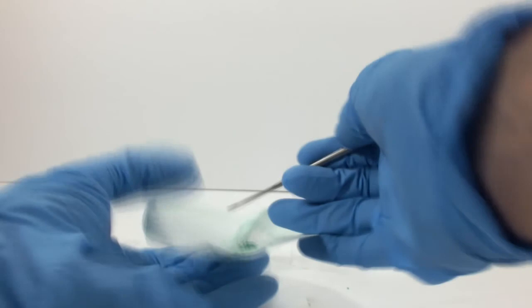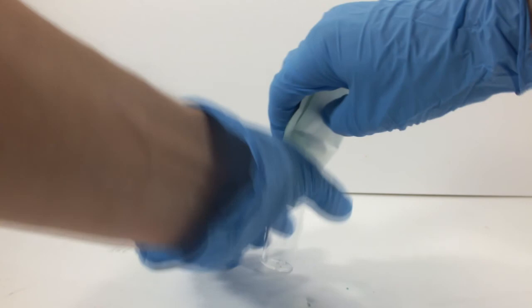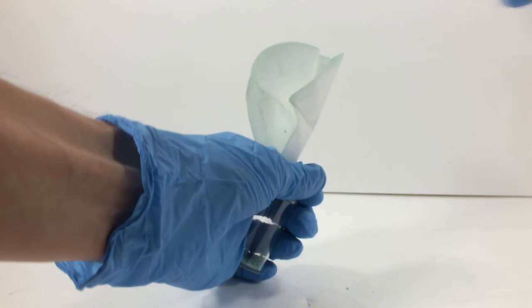As I said, there was so little to begin with, I left it on the paper. Graciously, it scrapes off very easily as this dark green-blue powder. There was a total of 0.15 grams recovered, which is slightly less than an abysmal yield. We're talking single digits. But it worked.